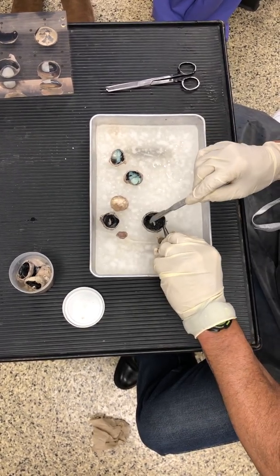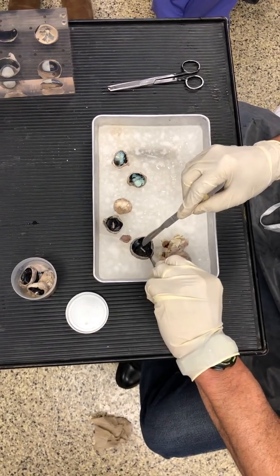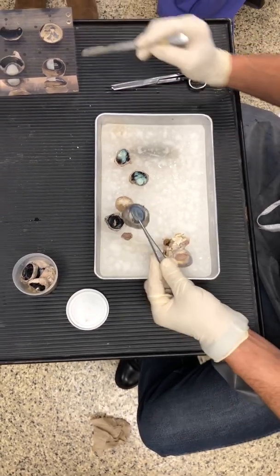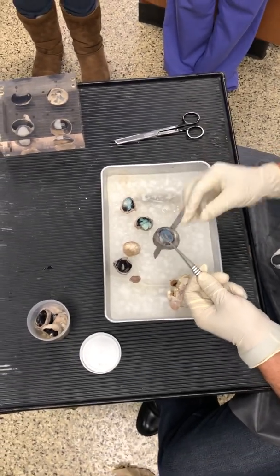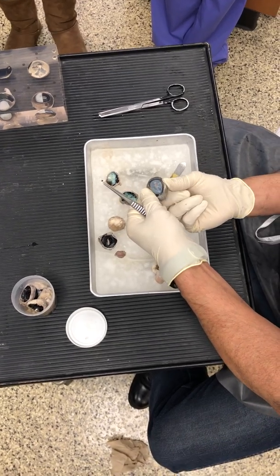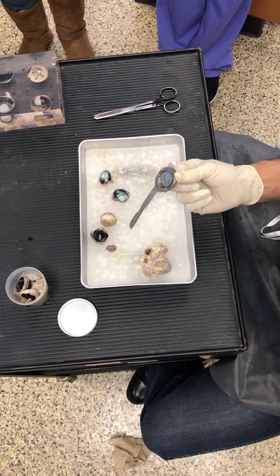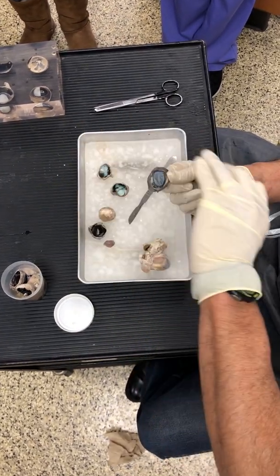Then, folks, there is the hole in the eye. We can see it at the back, and the hole in the eye is the pupil. There you can see they've cut the cornea away so you can see the pupil. There's the cornea. And notice the cornea is opaque. Our corneas are colorless. If you look sideways at our eyes, you can kind of see a cornea. Our corneas don't project very far out.